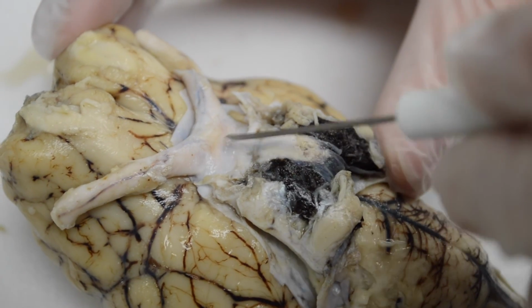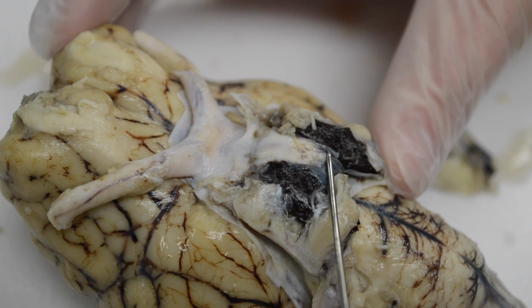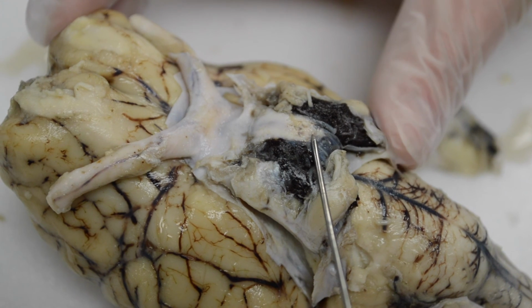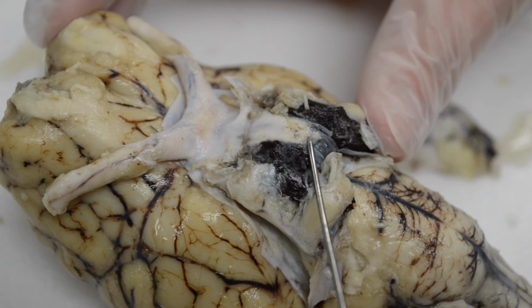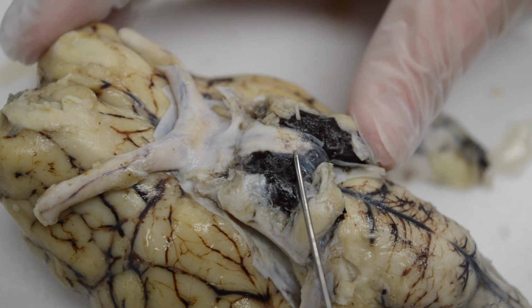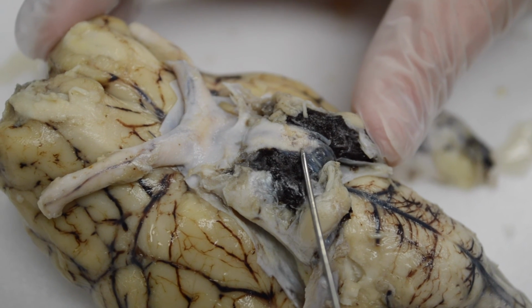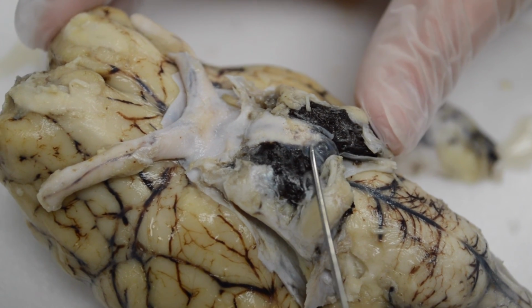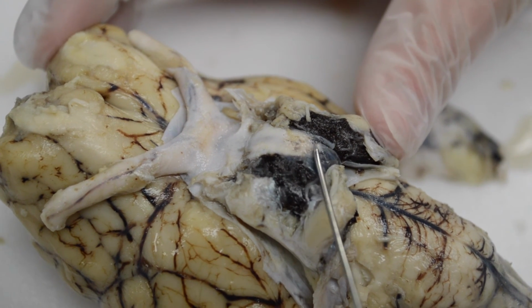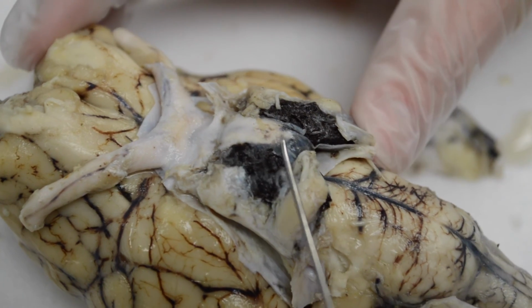It hangs below. But the infundibulum right behind, and then right behind that, this bump here is called the mammillary body. And in sheep, as what we're looking at right now, the mammillary body is much bigger than it is in humans, and that's because they have a sharper sense. It's for smell, because I understand that they can't see as well, so smell helps to protect them. So they have a larger mammillary body that helps them as a protective mechanism.